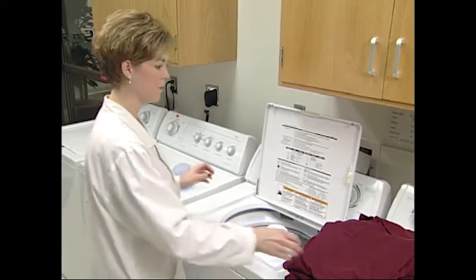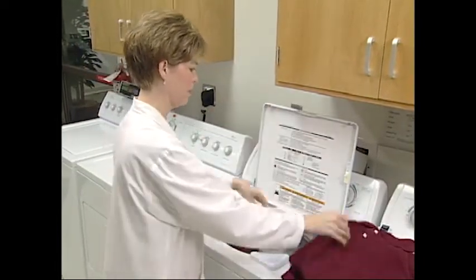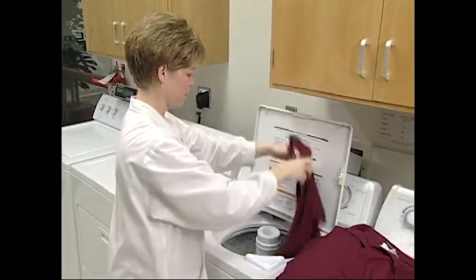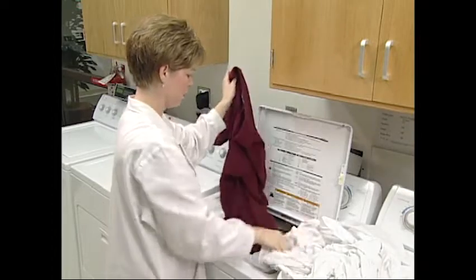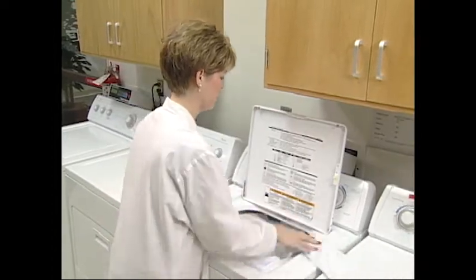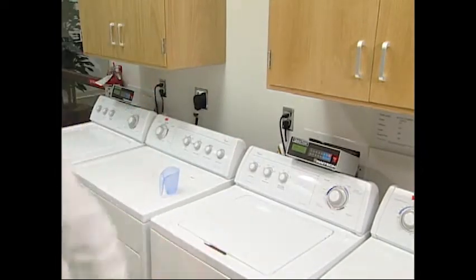Two of the most adopted test methods used around the world are AATCC Test Method 135, titled Dimensional Changes of Fabrics after Home Laundering, and AATCC Test Method 150, titled Dimensional Changes of Garments after Home Laundering. These procedures are used to predict dimensional changes that occur after home machine washing and drying.